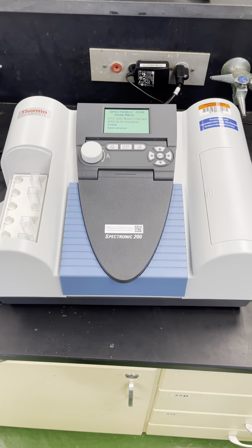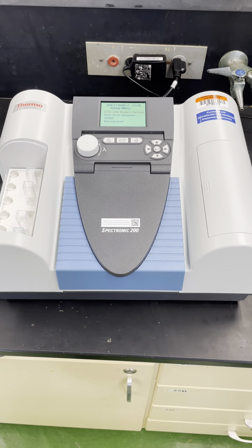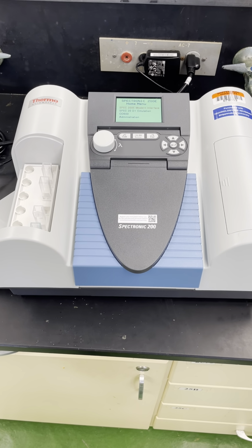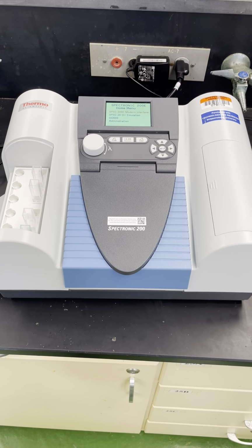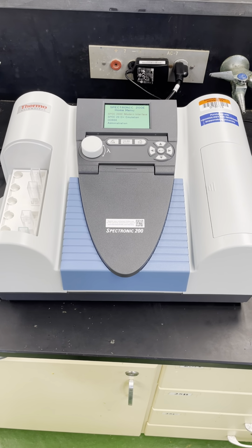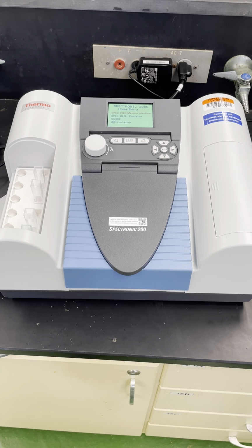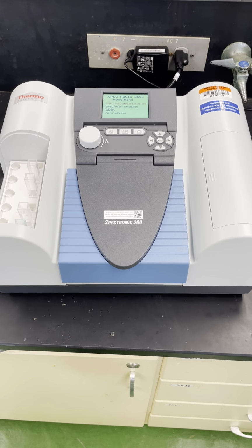I'm going to start off by pointing out some important things about the setup, and then from there we'll go on to talk about the different options that you have in terms of measurements to take, and so forth. Remember that you always have the manual that was provided to you as well. It's pretty detailed and gives you a pretty good account of how to use this instrument.